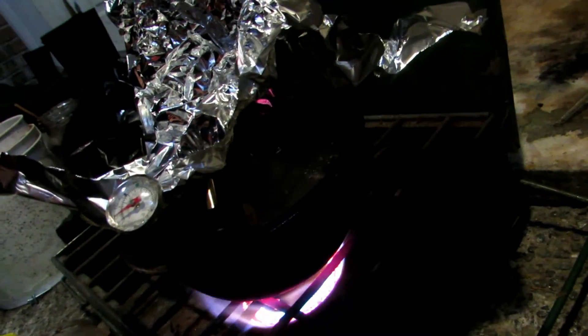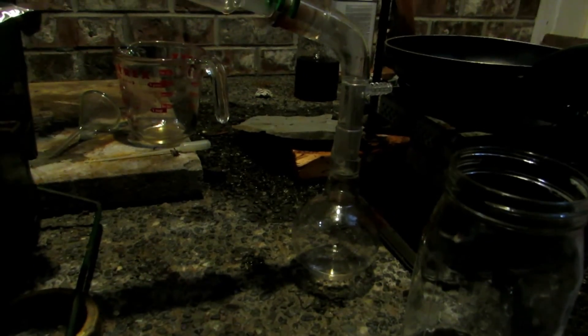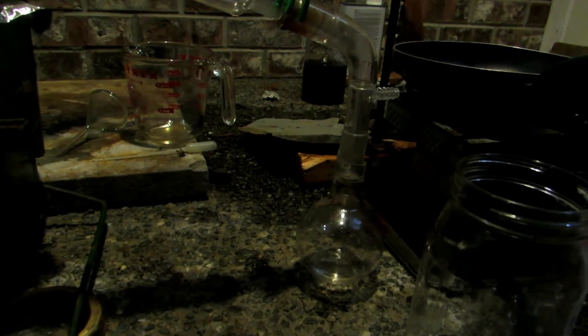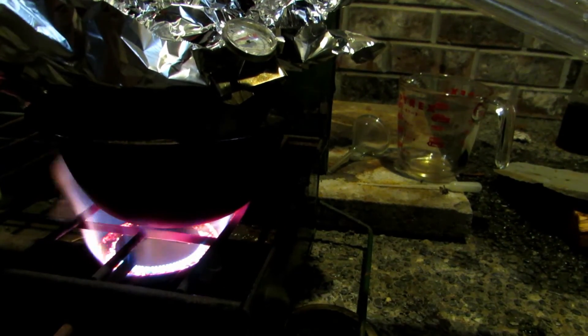Over here it's very hot, with vigorous boiling going on in the flask. Everything seems to be holding up, but there's a lot of bumping occurring and the whole apparatus is shaking. You can hear loud jolts every now and then. We've also broken the thermometer — it got too hot; it went around several times up to 300 degrees as I mentioned, and now it's broken.